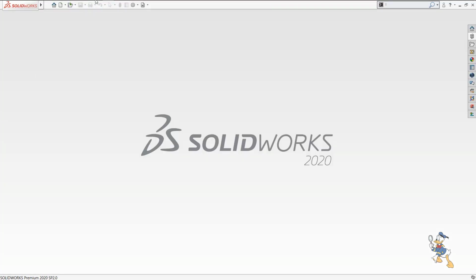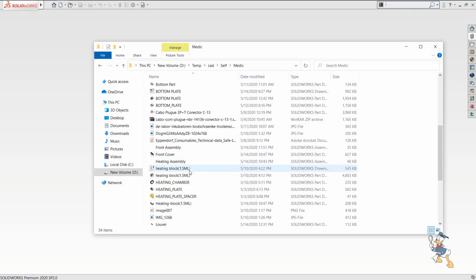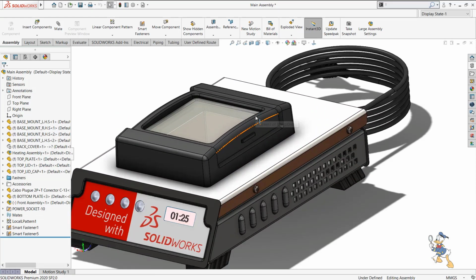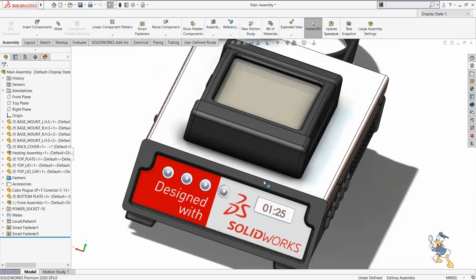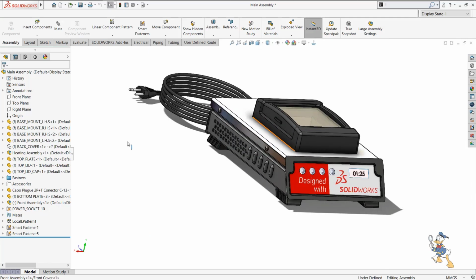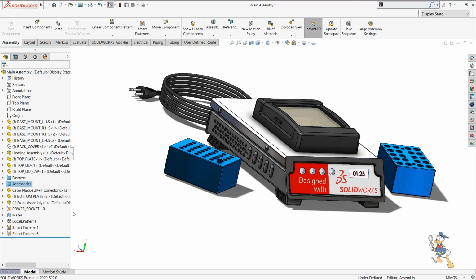I have already assembled this kind of assembly. When we come to the end, when we design some sort of assembly properly and make things happen, which is very useful in assembly designing, and suppose we need to show some sort of accessories as well.